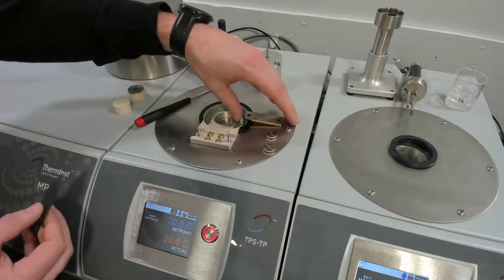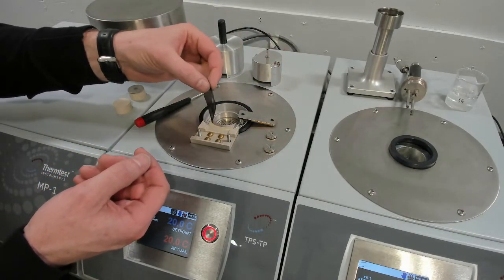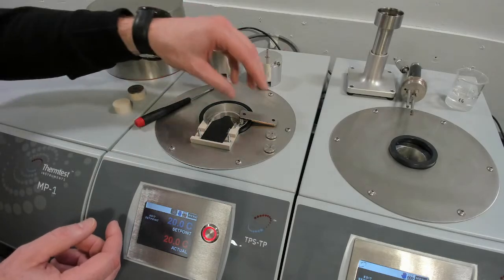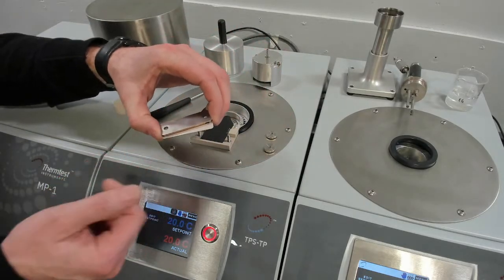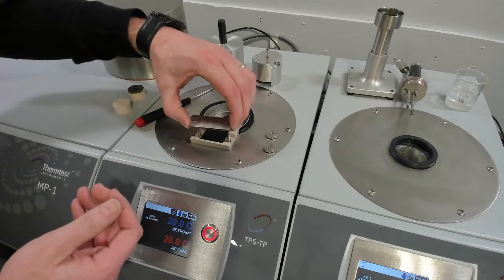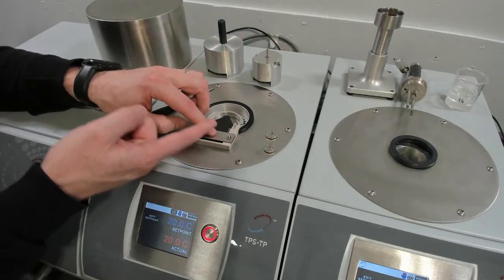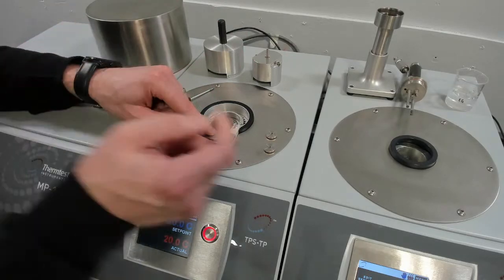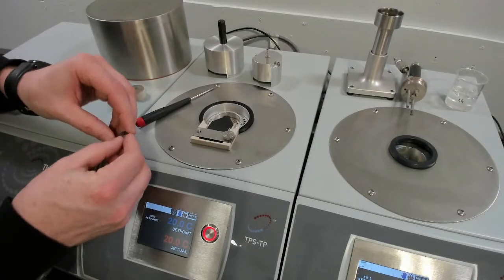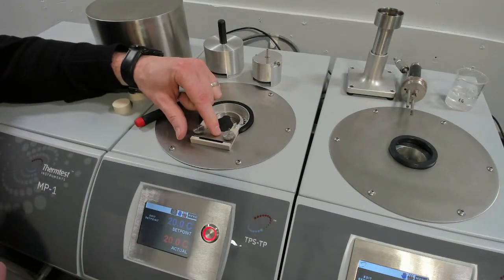So I have this disassembled. We don't normally have to take this off, but I thought it'd be kind of neat to show what the contacts look like. So we put these facing down, and there's a cutaway to show where the sensor goes. The plate that we use to secure the sensor to the contact points has a mica board which electrically isolates, and if you were to ever overpressure the contact, those individual electrical contacts won't poke up through and short out your sensor. These are knurled knobs which basically stay there permanently. I just again disassembled it to show what that might look like.